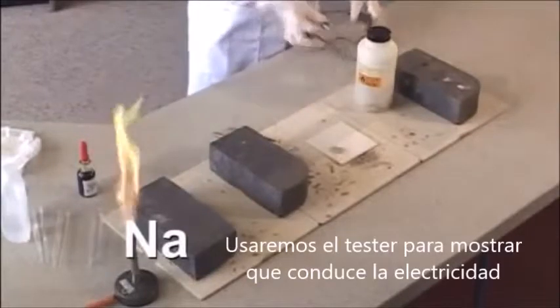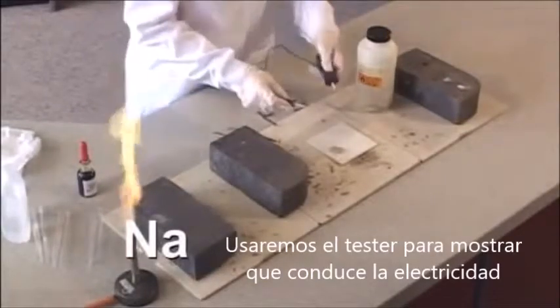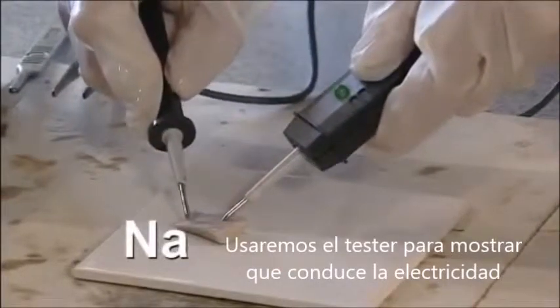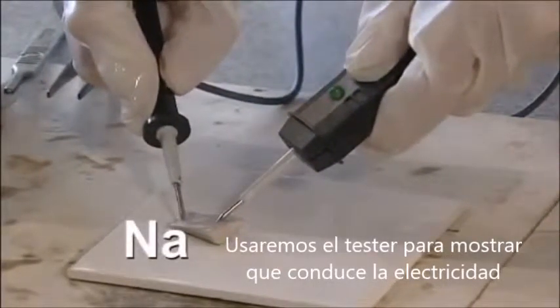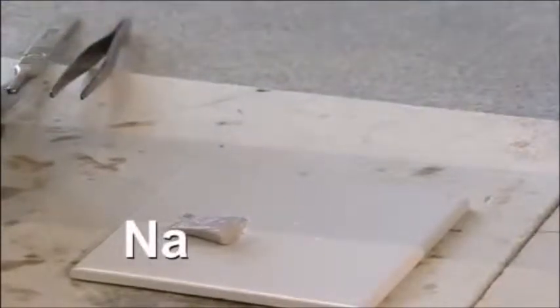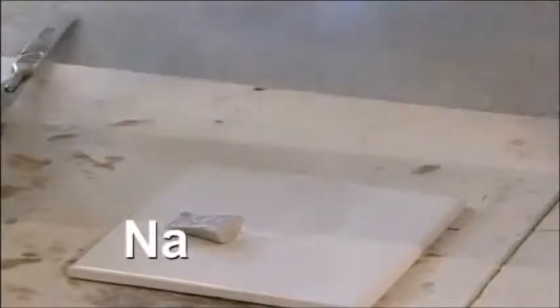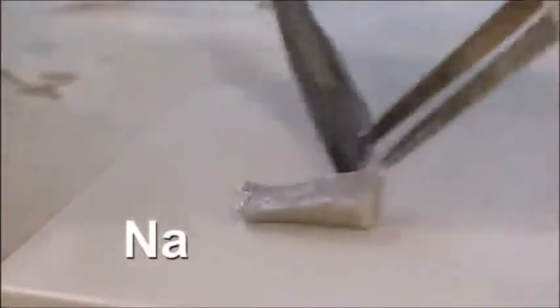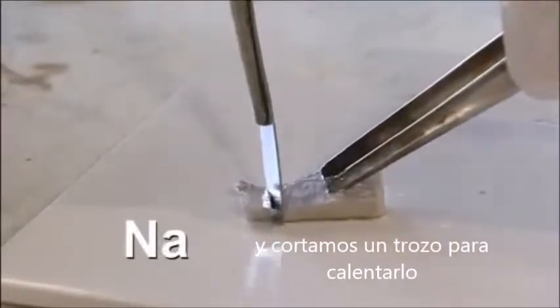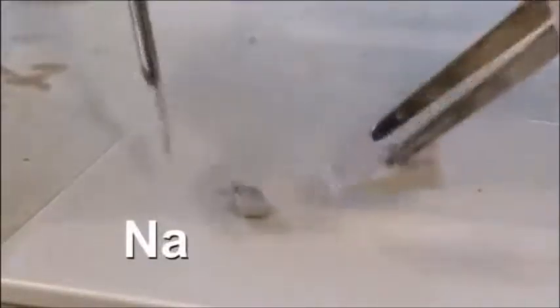We can use a circuit tester to show that it conducts electricity. And cut off a small piece ready to heat in air.